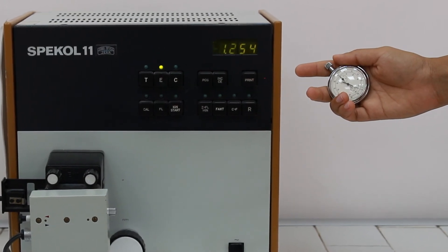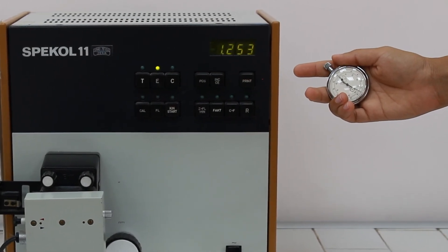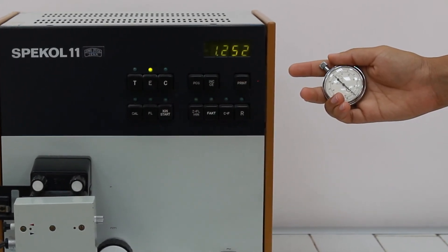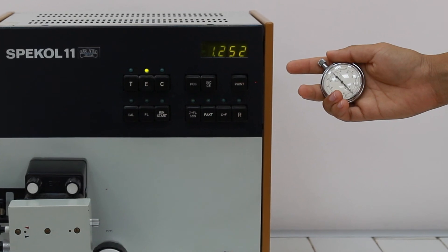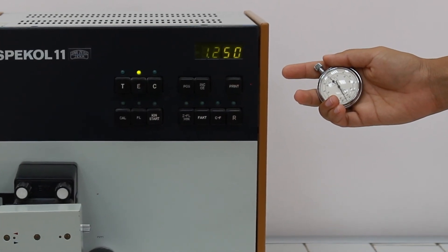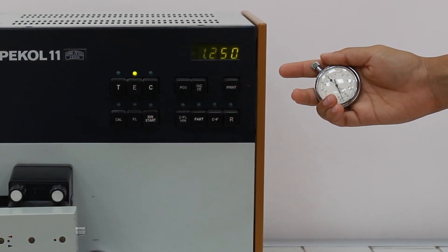Since NADH coenzyme is consumed during this reaction, follow the decrease of the absorbance.